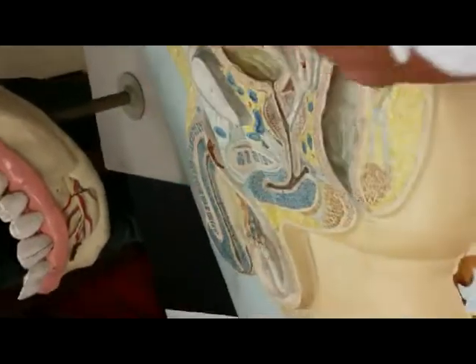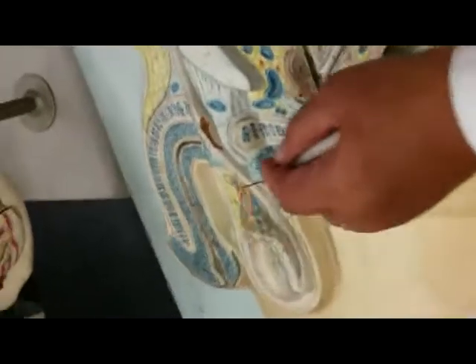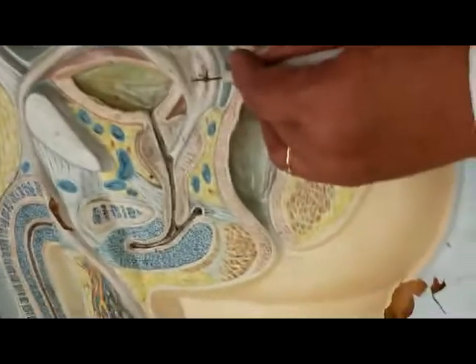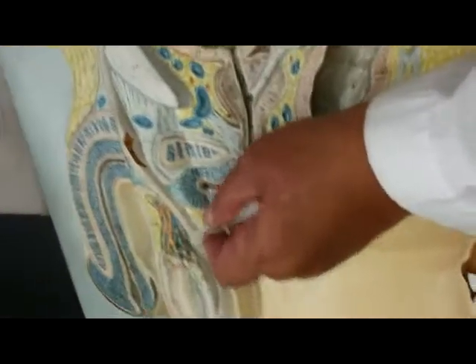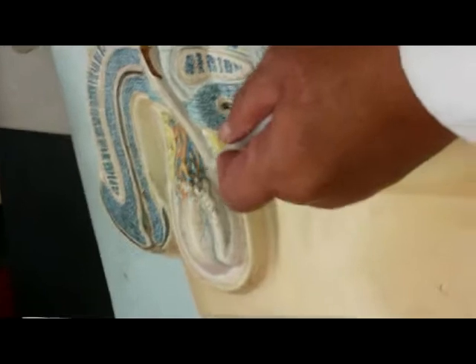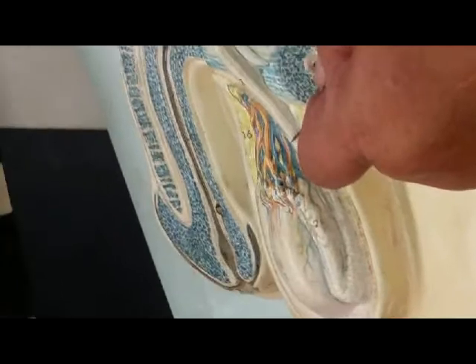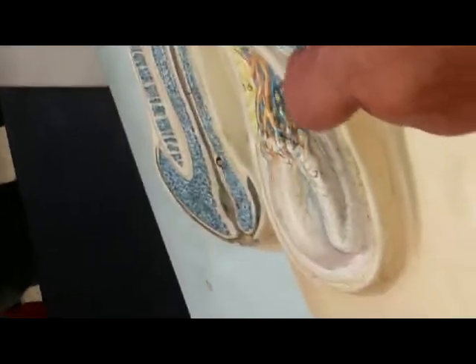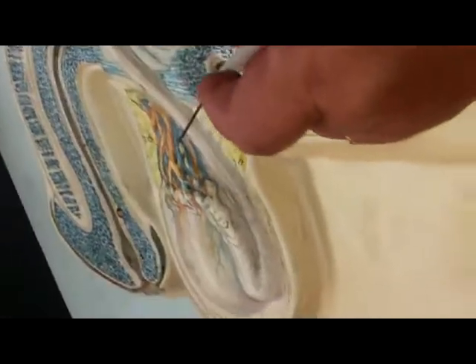Now let's go back to here. I've already shown you the scrotum and the testis and the epididymis. And I showed you the ductus or the vas deferens. I showed you now the spermatic cord. This is part of it, but we have a better model to show the spermatic cord. The spermatic cord would include the testicular artery, the testicular vein, the vas deferens, cremaster muscle. All of that is part of the spermatic cord, but better shown on another model. And now I showed you the prostate gland. I showed you also the seminal vesicle.